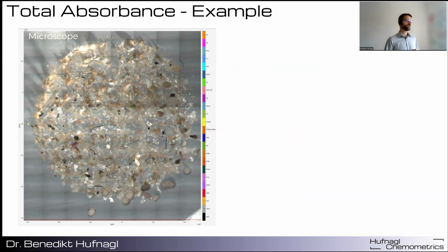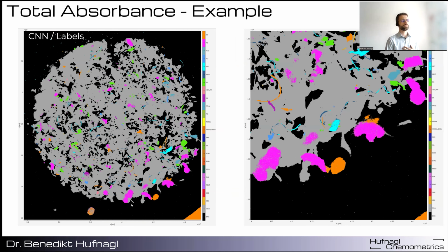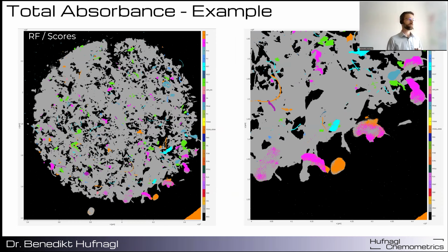Now let's have a look at the real-world application case. This is a large environmental sample measured with the Bruker Lumos 2. And you have some very thick particles here. This is a zoomed-in view of that part. And now you can see the result from the CNN. You can see that these particles are still recognized well. Now let's compare that with the random forest. And you can see that here this is just a noisy cloud. It's still able to recognize it, but it's not as competitive as the convolutional neural network.